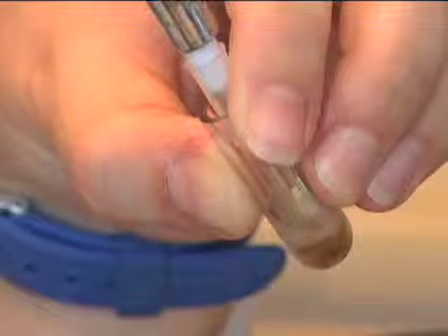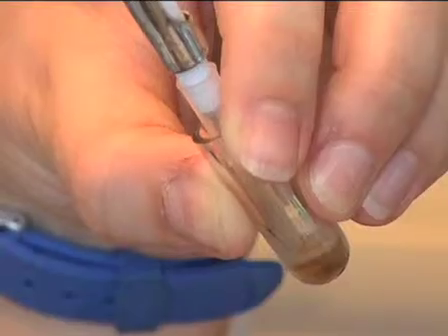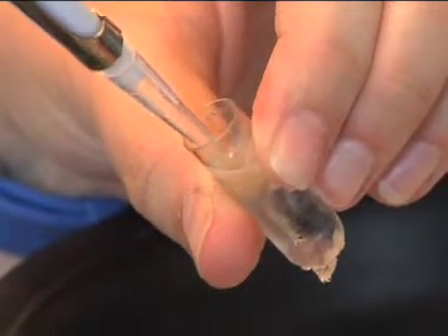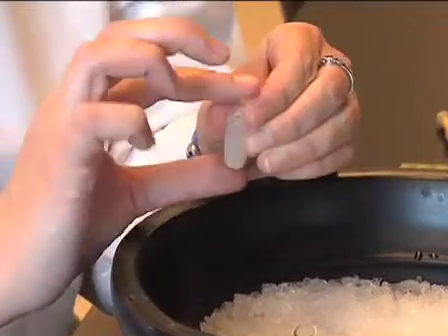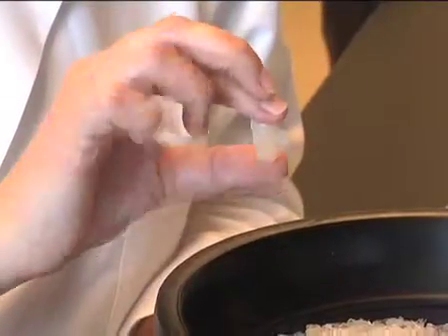Now I'll demonstrate how to collect the light membrane fraction from the Xenopus egg extract. Using a micropipetter with a cutoff or wide-bore pipette tip, carefully remove the light membrane fraction from the membrane layer, leaving dark membranes undisturbed. Transfer the light membranes to a 2.5 ml ultra-clear tube containing 1.5 ml egg lysis buffer. Begin to disperse the membranes in buffer by pipetting three times with a 1 ml micropipetter tip, then hold parafilm over the top of the tube and invert several times to gently complete dispersion.